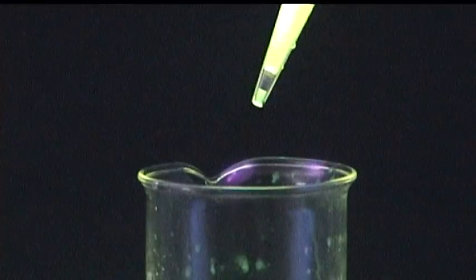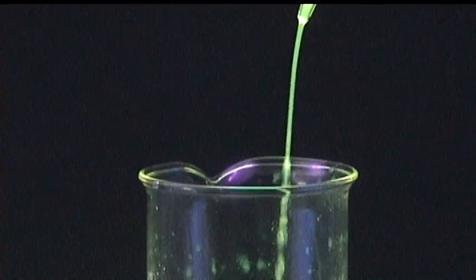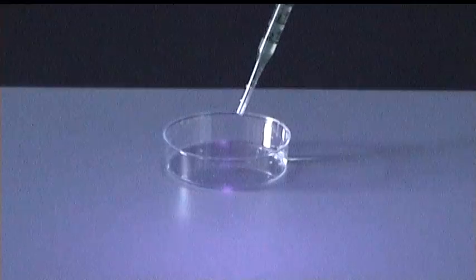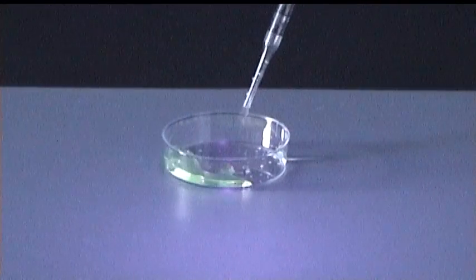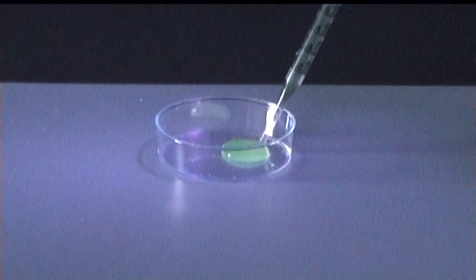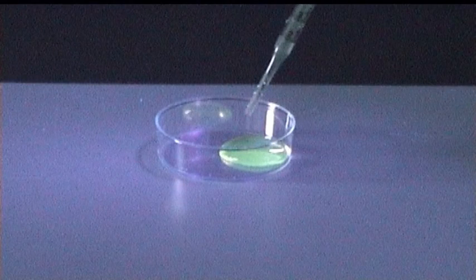When pipetting large volumes, aerosols can be generated when trying to blow out the last drop out of the pipette, as demonstrated by the two following examples. As you can see, aerosols and splashes are generated, which can end up on the bench, your gloves, or any other surface. Therefore, always drain a pipette with its tip against the inner wall of the receiving vessel and never forcibly expel any hazardous material from a pipette.